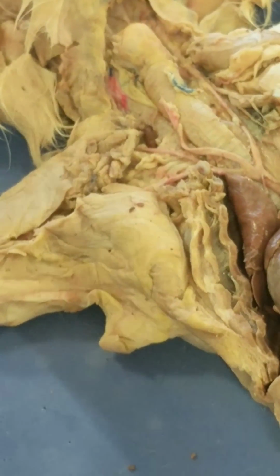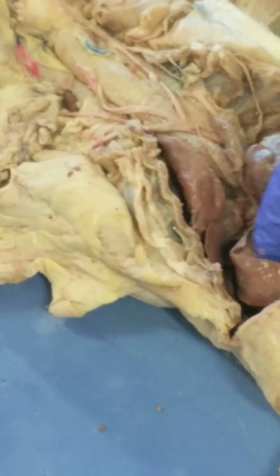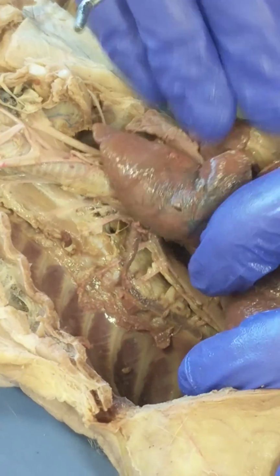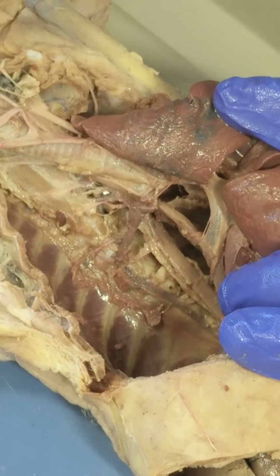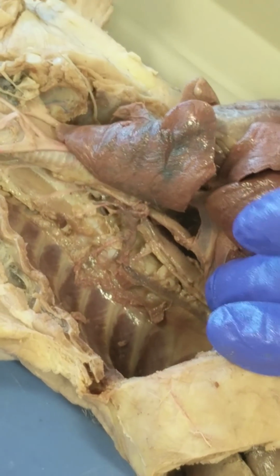The azygous vein. Oh, the azygous vein. Thanks, Brian. Okay, so the azygous vein, right, that's why he's over here. It is on the right side of the thorax. It's not very good in this cat. We have another cat that it's injected very blue, but this is the azygous vein, and it drains blood from the dorsal thoracic wall right into the heart.